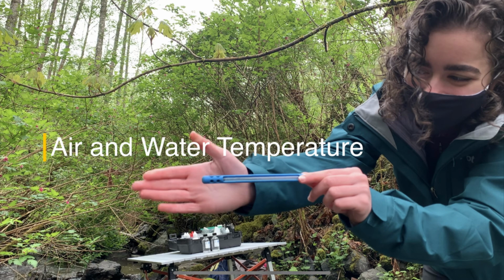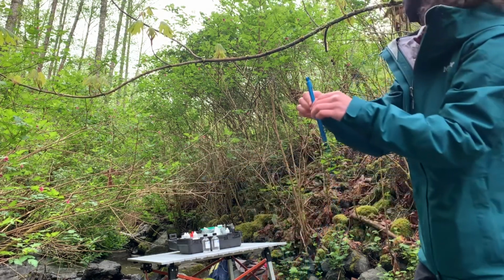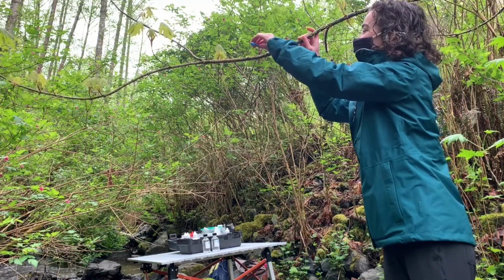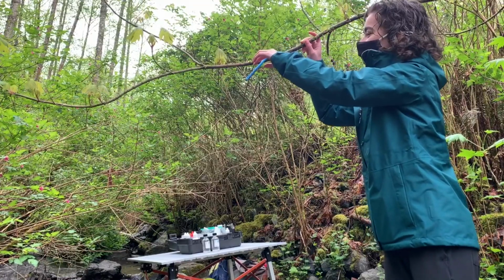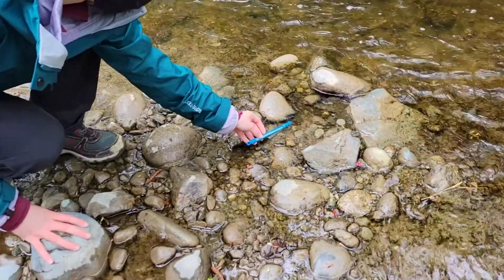Temperature influences aquatic organisms by affecting how quickly nutrients cycle through the aquatic system. Water temperatures can be increased by runoff from power-generating plants or heat impervious surfaces. To perform the air temperature test, we simply find a secure place to hang the thermometer in the shade until it stabilizes. Then we submerge the thermometer in a representative spot in the water to allow it to stabilize again.